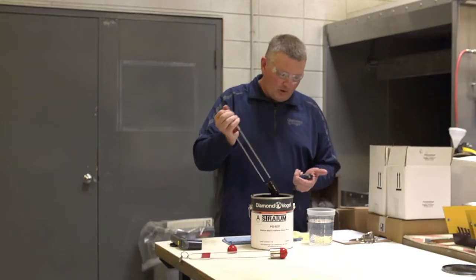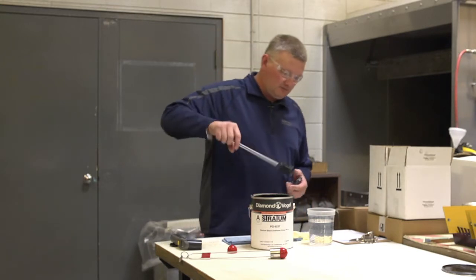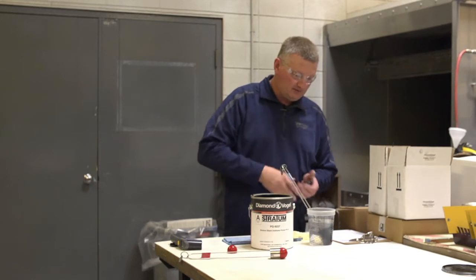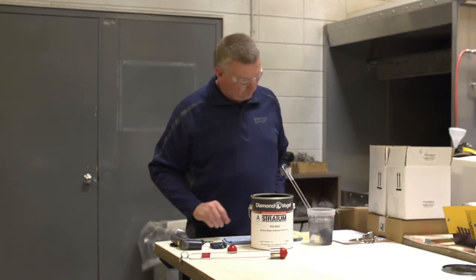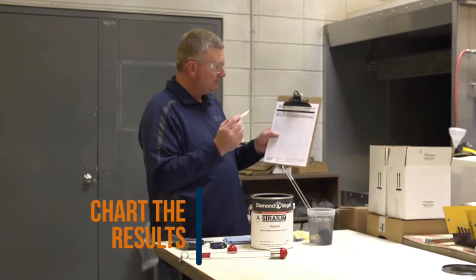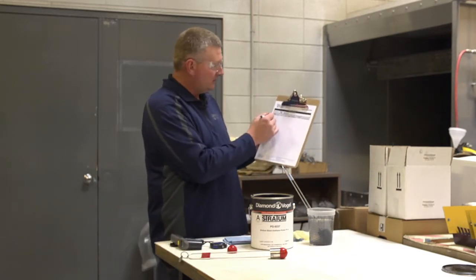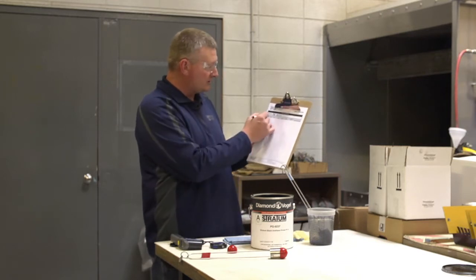Okay, 22 seconds. Dump any excess out, put in a cup of clean solvent. Then we'll chart product PG-9237. New barrel — it's a new gallon, so we would circle yes.